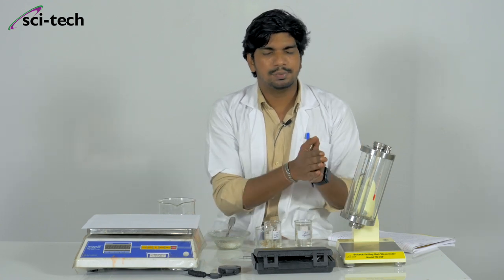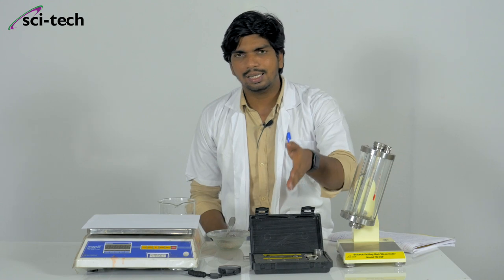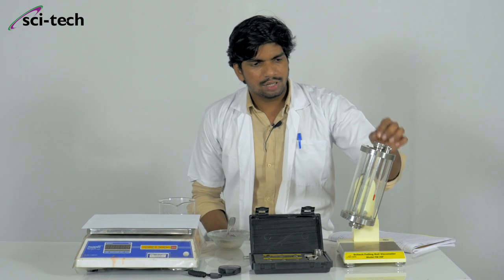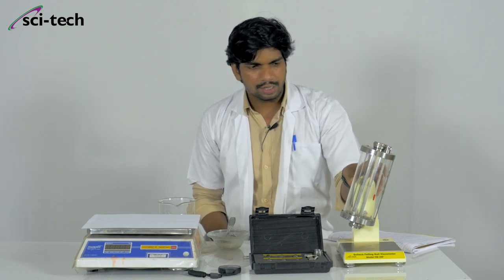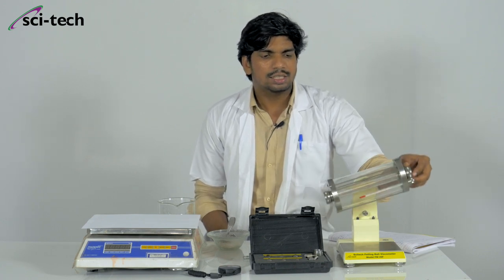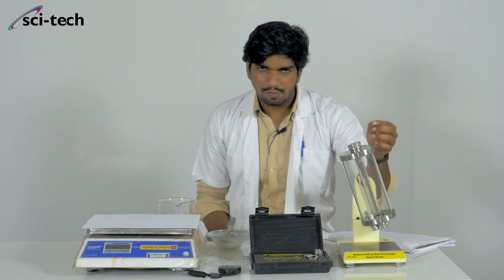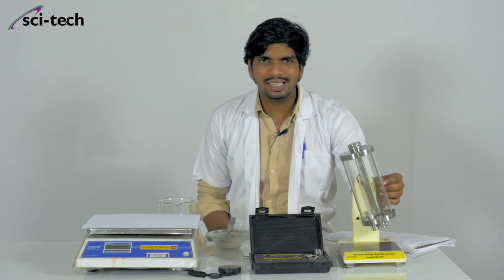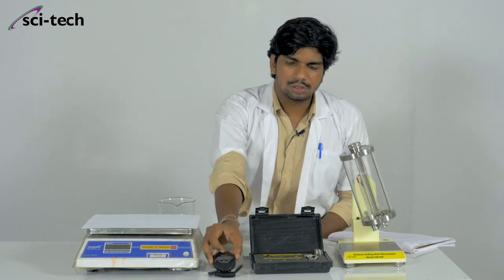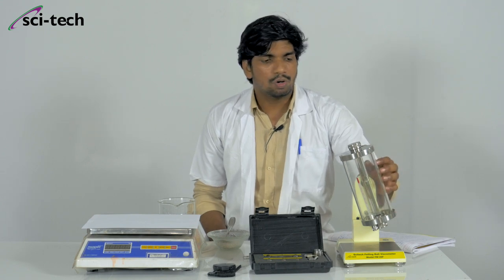Simply put, for the experiment we have some metal and glass balls. These balls have known ball constants, diameters, and weights. We fill the Newtonian fluid inside the glass tube and put the ball in from the top. Then we turn it at an angle and measure the time it takes for the ball to fall under gravity at 10 degrees until it reaches the bottom. We use the stopwatch to calculate how much time it takes for the ball to travel from top to bottom.